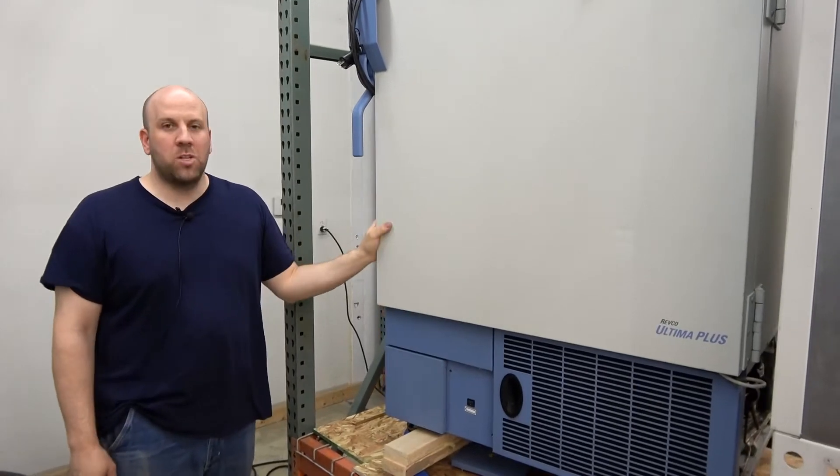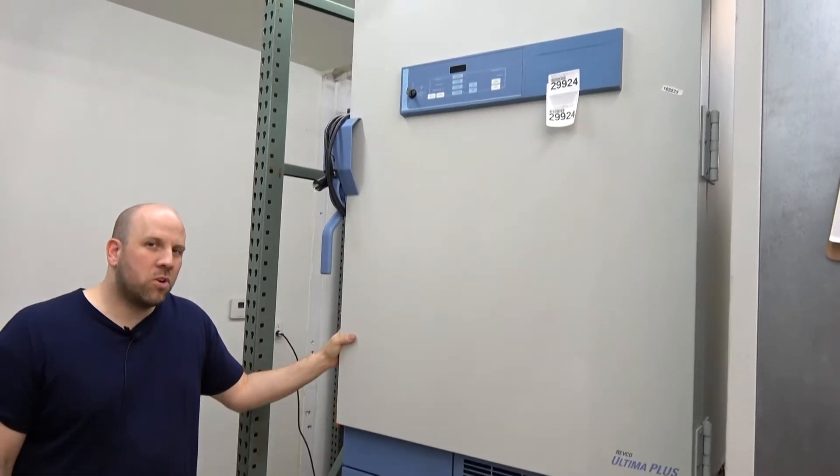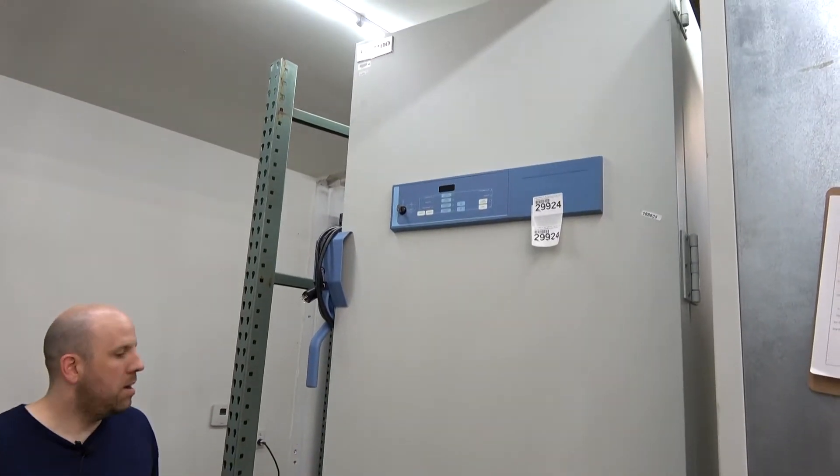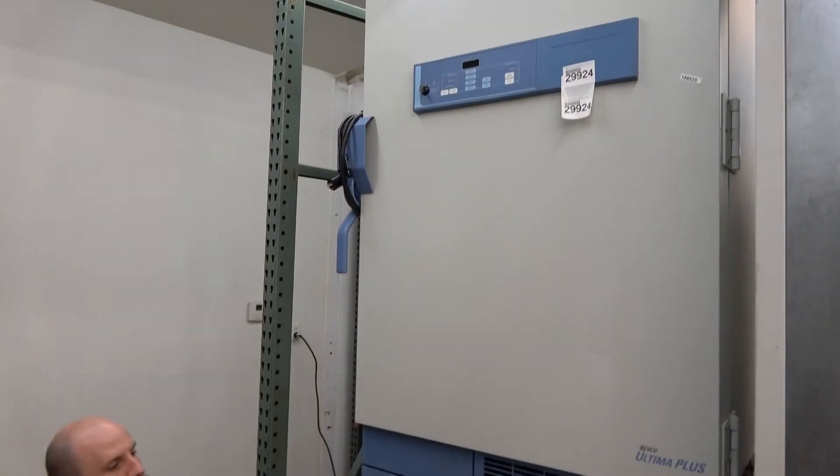These are mostly the kind of models we get, Thermo-RevCo, this time period, usually newer for the most part. Let's kind of dive in here, show you what we do.